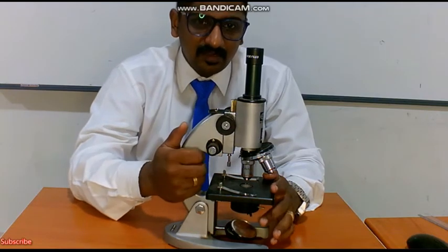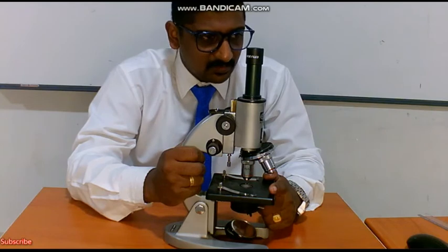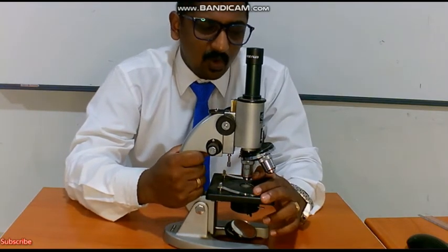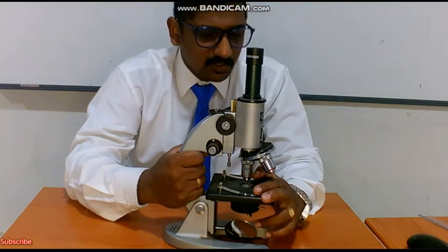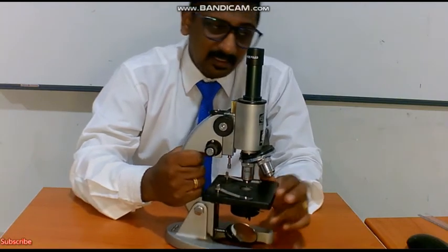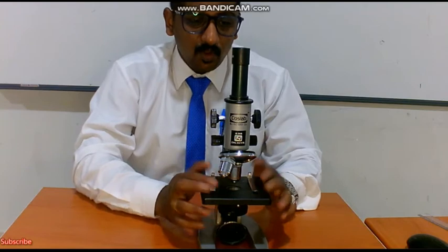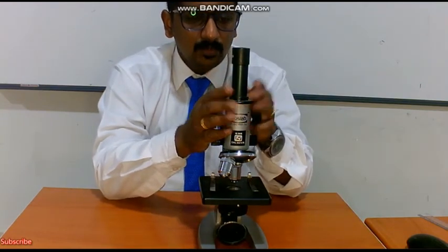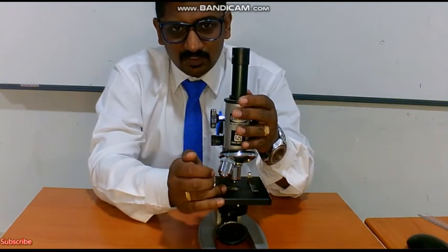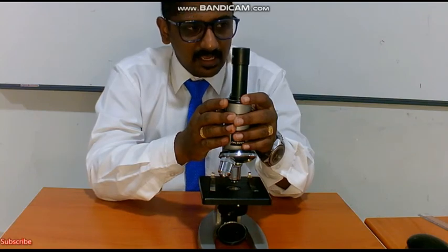So these are the various parts of a compound microscope, which are very essential and will come in your examination also. I have posted in the classroom what you have to do and write for your experimentation, children, kindly do it. Any doubt, kindly post and I am there to support you. When the school reopens, children, you have to work on the compound microscope. You have to adjust the light, name the various parts, and I'll be giving you the specimen. You have to observe it in low power as well as high power of the microscope.